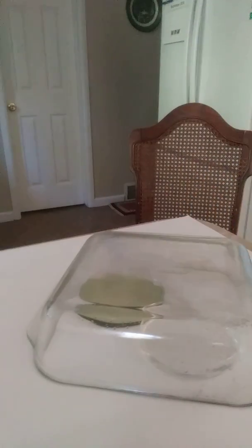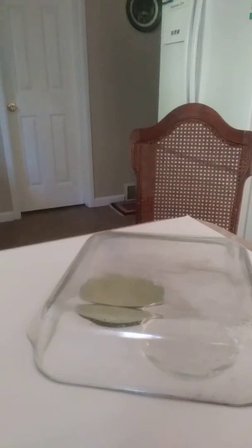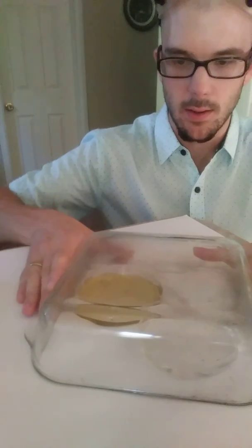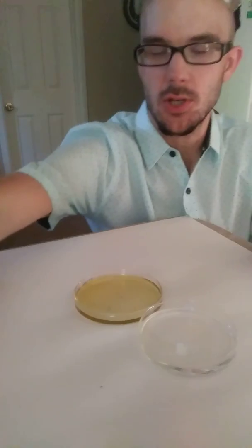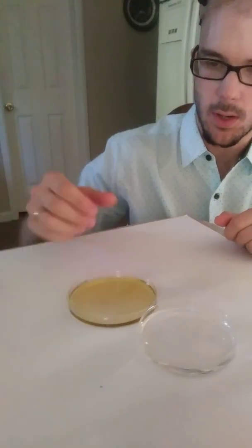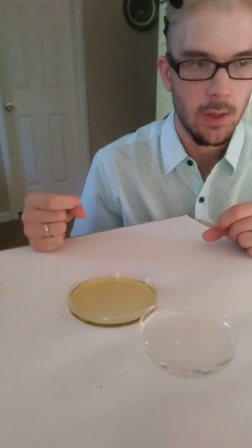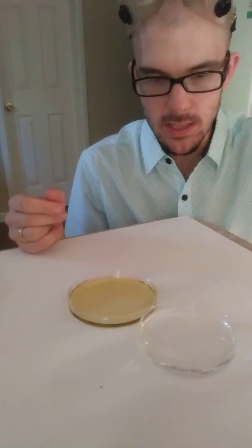About 15 or 20 minutes have gone by and you can tell there's a very significant change in the color of our BTB — it's gone from a green neutral color to a bright yellow. I didn't put anything inside it.